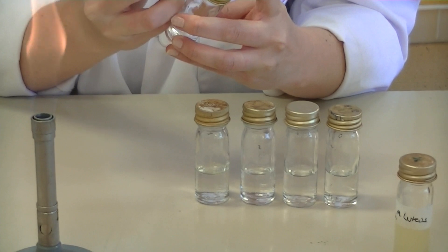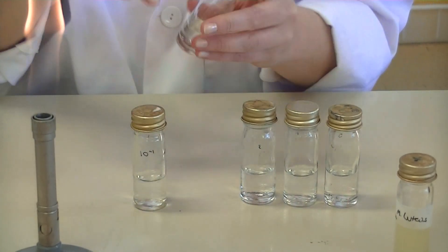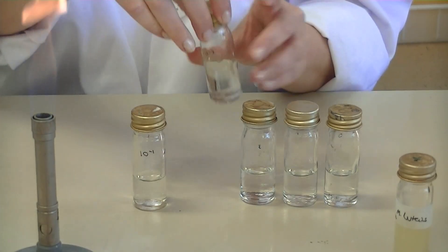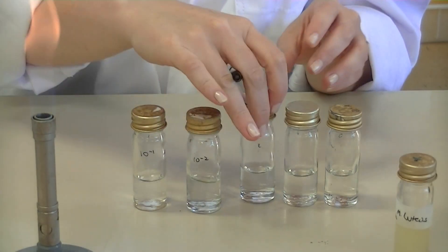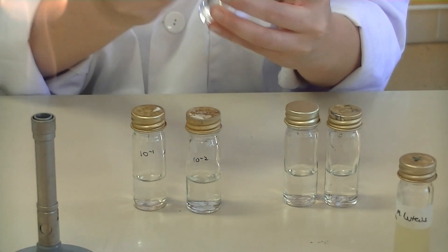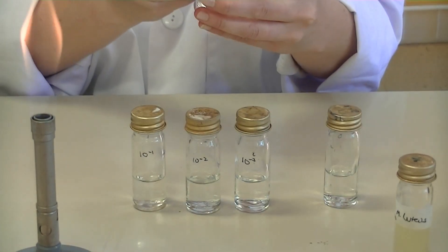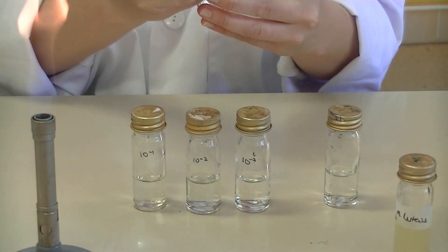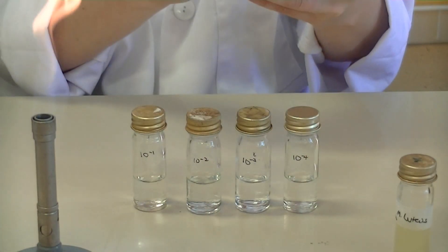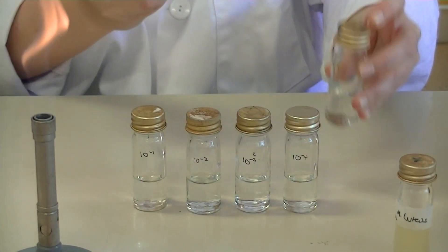Label the bottles: 10 to the minus 1, 10 to the minus 2, 10 to the minus 3, 10 to the minus 4, and finally 10 to the minus 5.